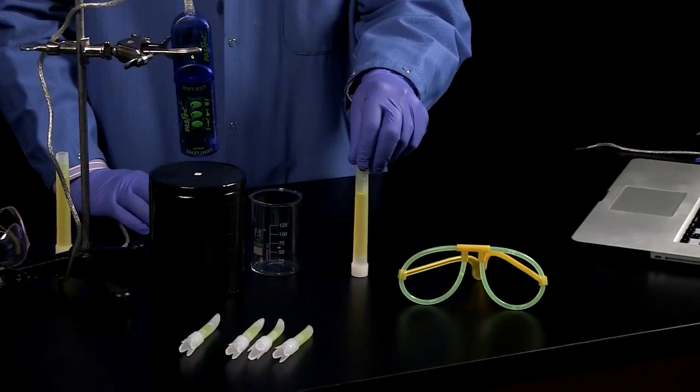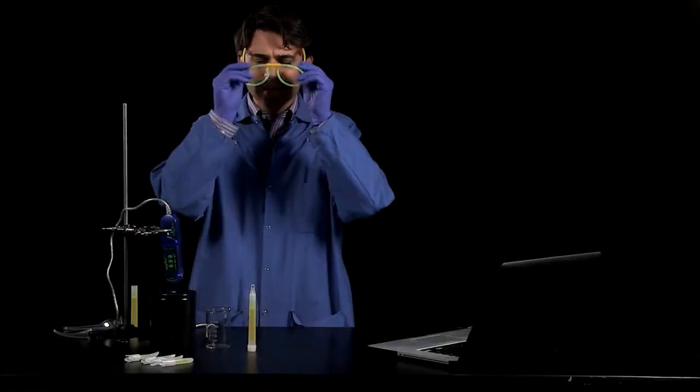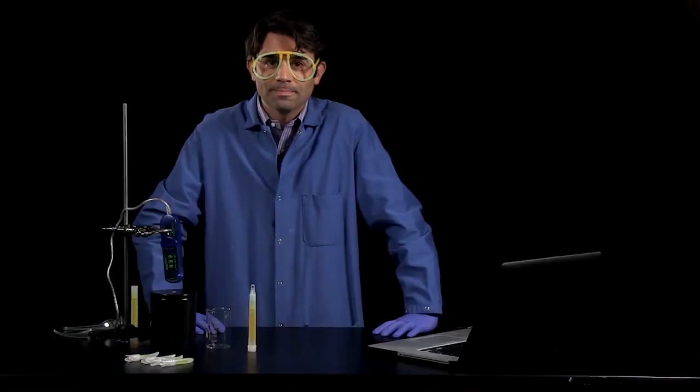Glow sticks come in a variety of shapes and sizes and are very popular, especially at this time of year. They also involve a good bit of chemistry.